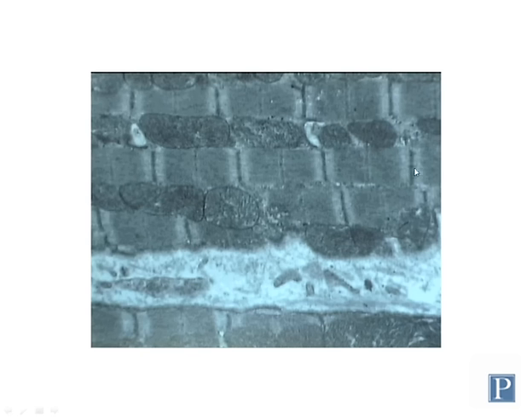Z disks are found at regular intervals, and each of these Z disks defines the boundary of the functional contractile unit of these myofibrils, which is called a sarcomere. So one sarcomere is from one Z disk to another Z disk. So here to here is one sarcomere, here to here is another sarcomere, here's part of another sarcomere, here's part of another one, and so forth. So Z disk to Z disk defines one sarcomere.